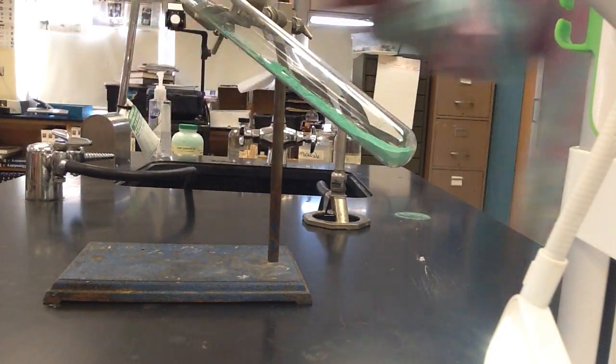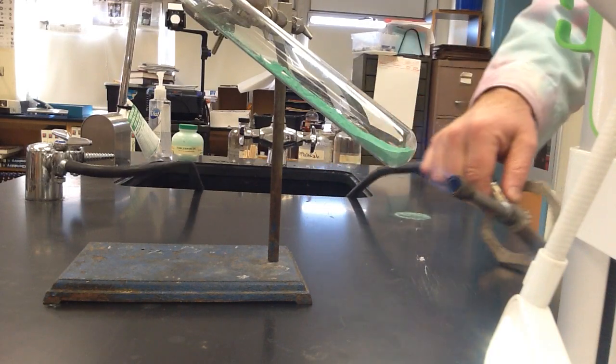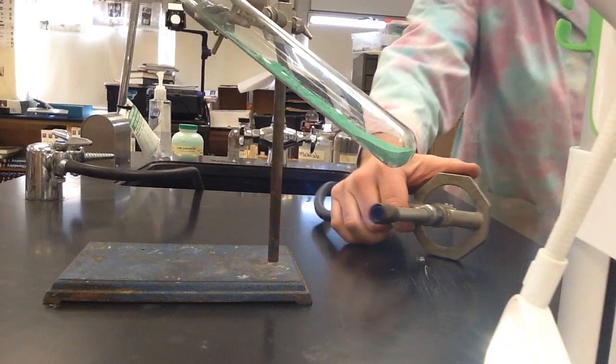So I'm going to light the Bunsen burner and I'm going to heat this gently, right?